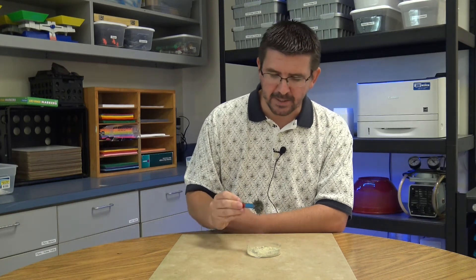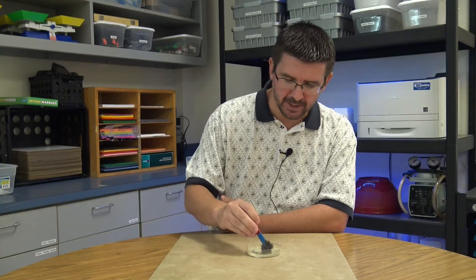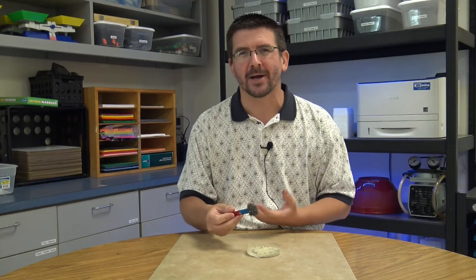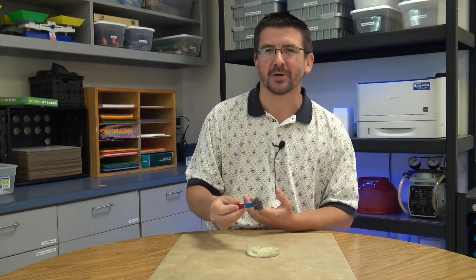So that's a pretty neat demonstration there, just being able to pick that out. Certainly if we wanted to get all of the iron out, we could continue to pass the magnet over it, sift it around a little bit, pass it over again. And with a little bit of work, we could get all of the iron back out of our sulfur.